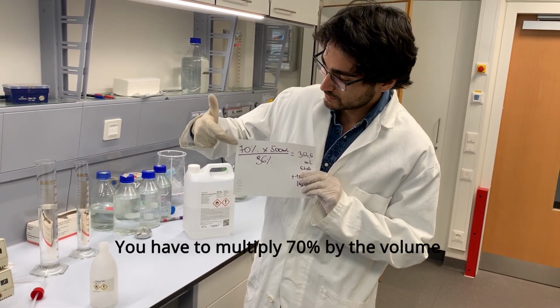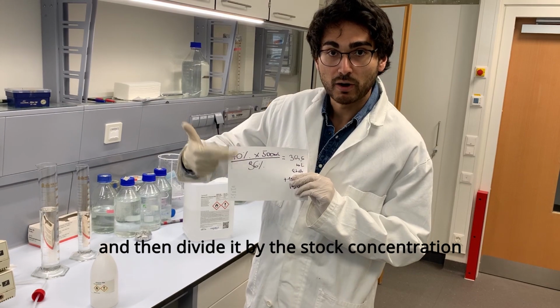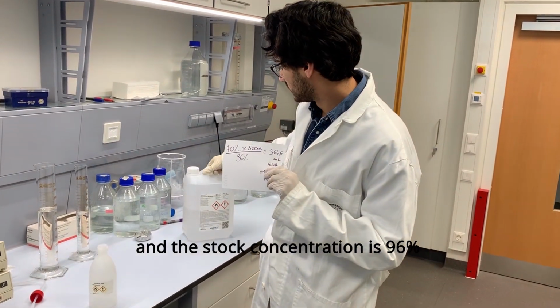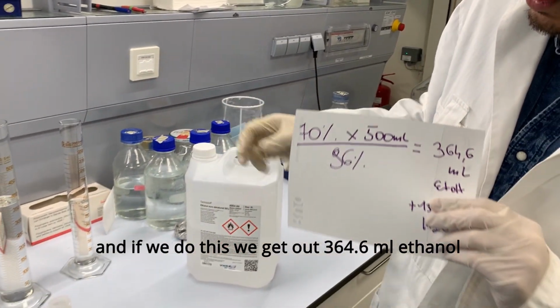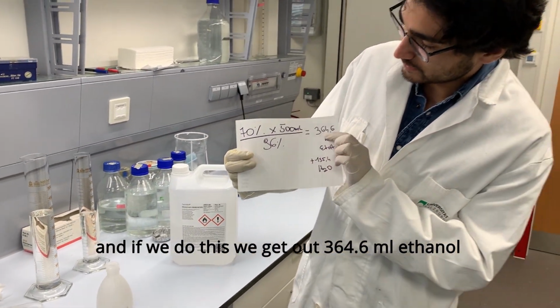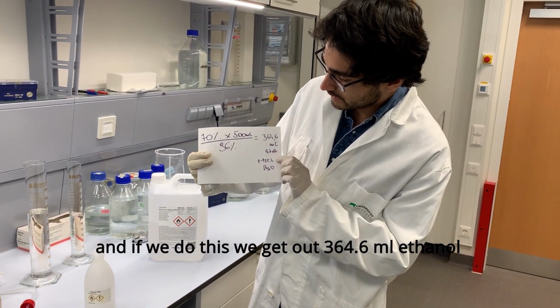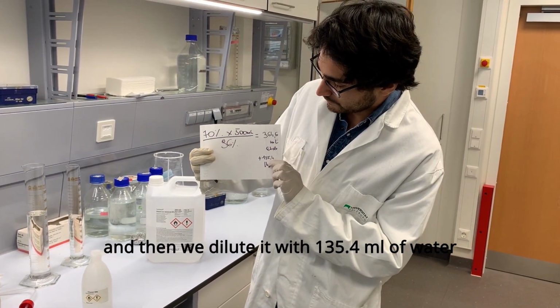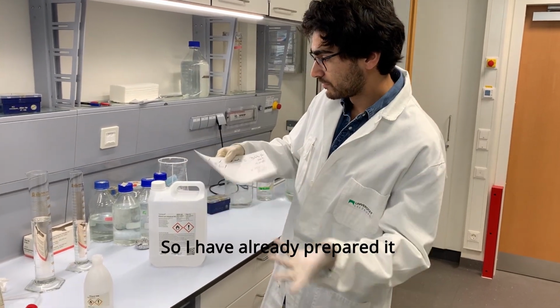The only thing you have to do is multiply 70 by your desired volume and then divide it by your stock concentration. And the stock concentration is 96%. If we do this, we get 364.6 milliliters of ethanol, and then we dilute it with 135.4 milliliters of H2O. So I've already prepared it.